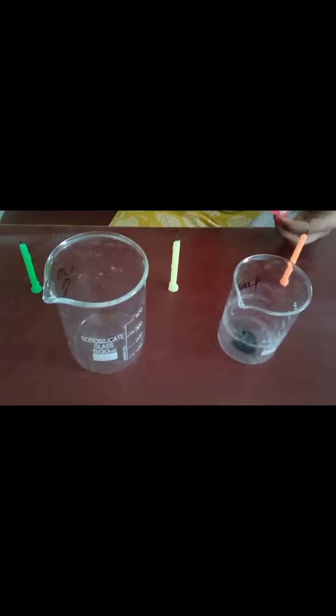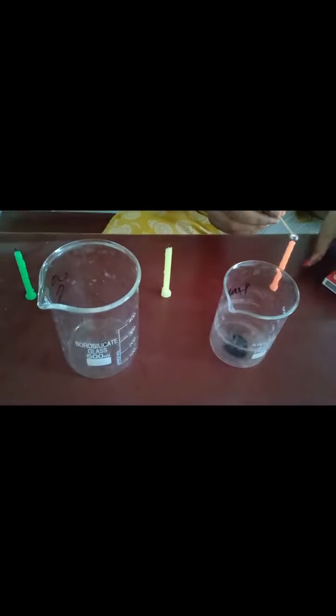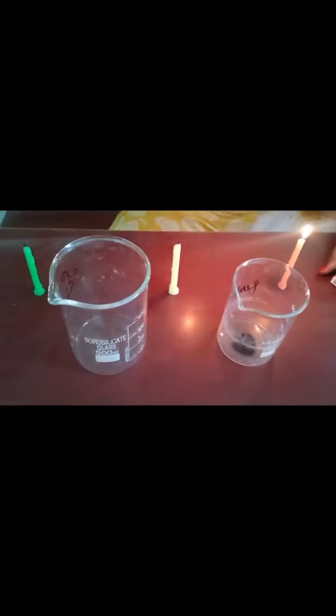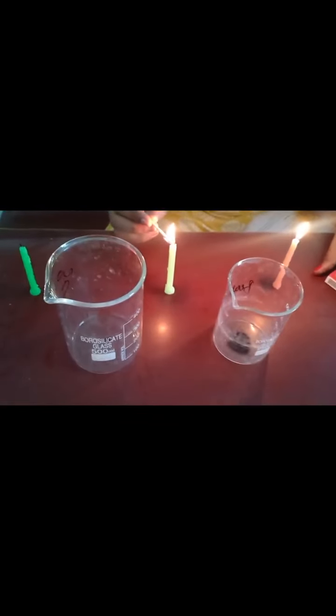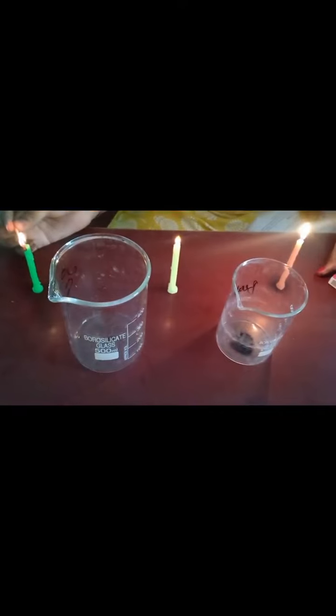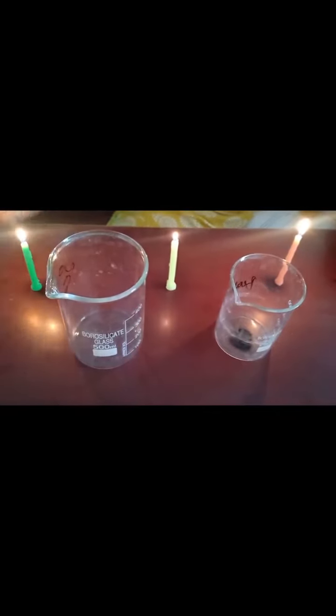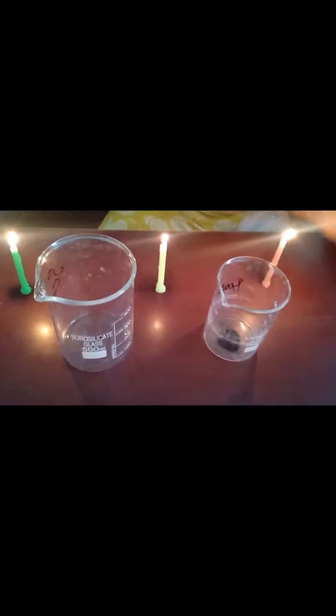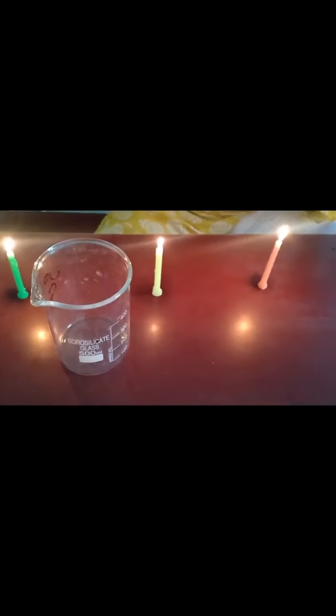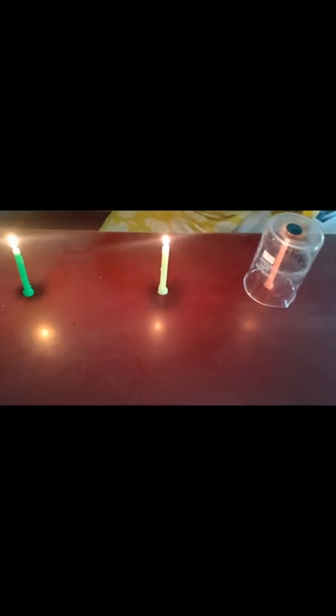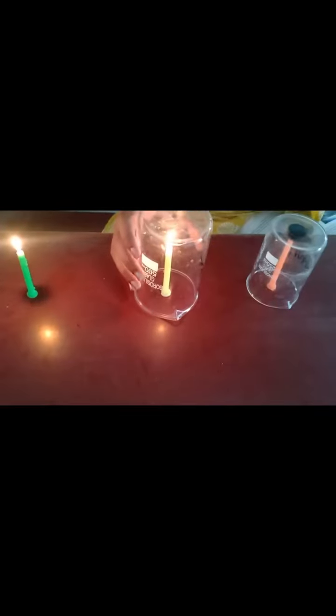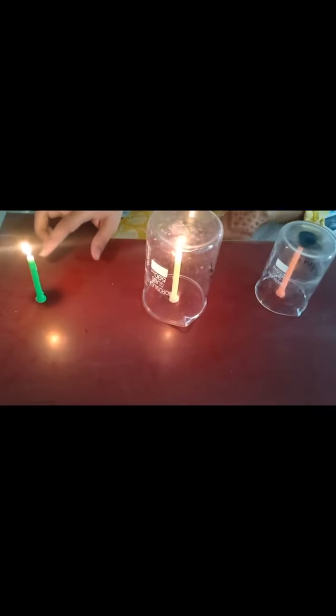Now I light up all the candles. After that I place a 250 ml beaker on a first candle, 500 ml beaker on second candle and leave the third candle uncovered.